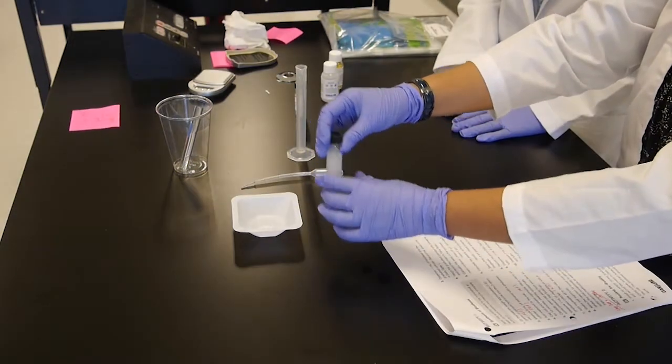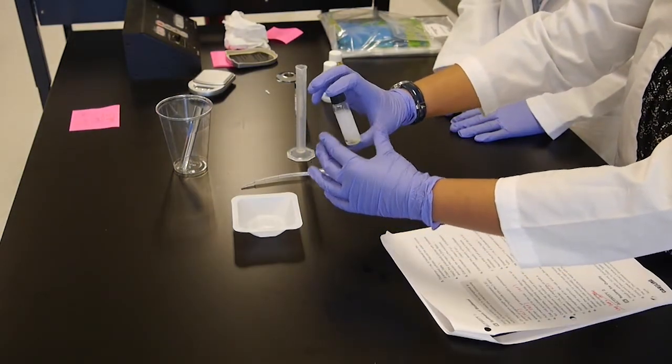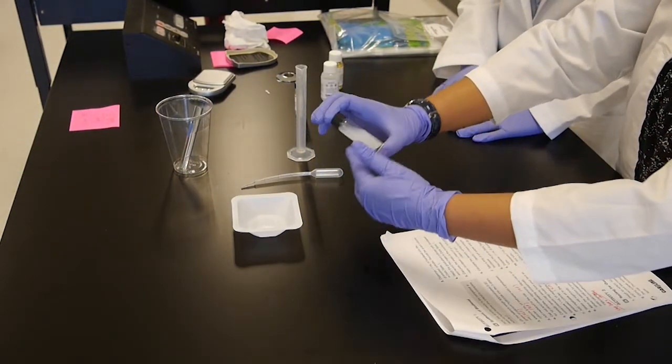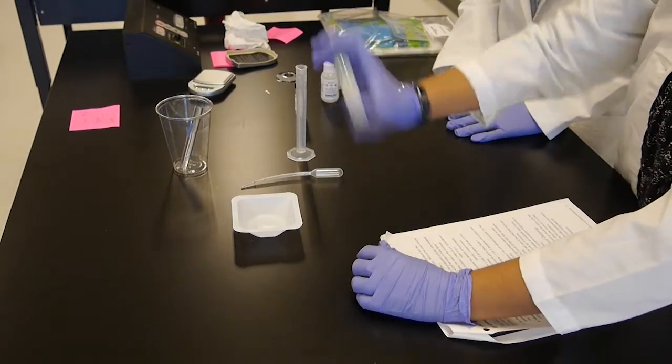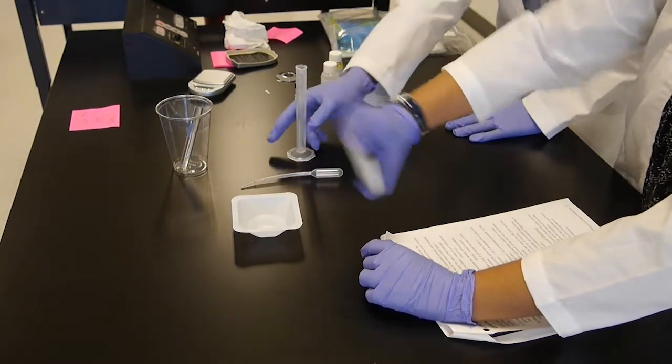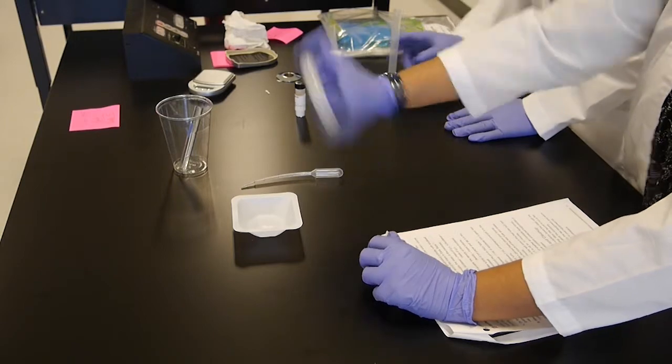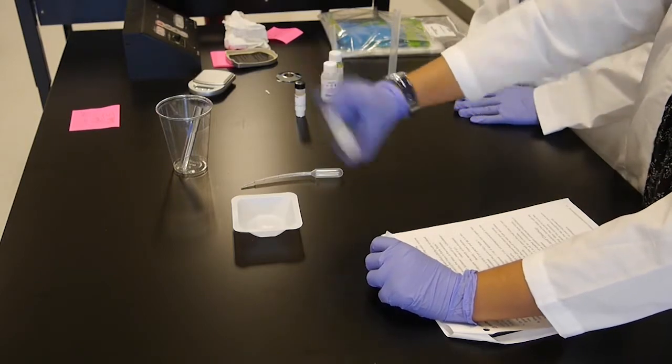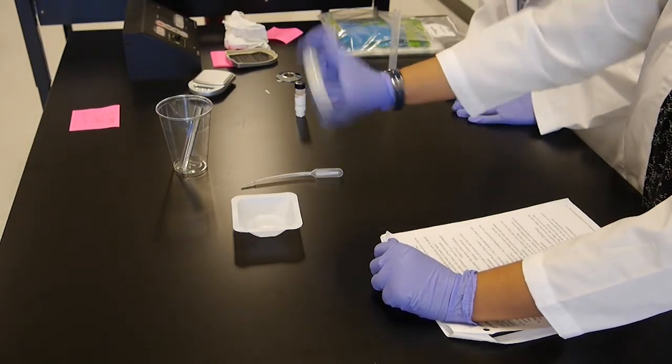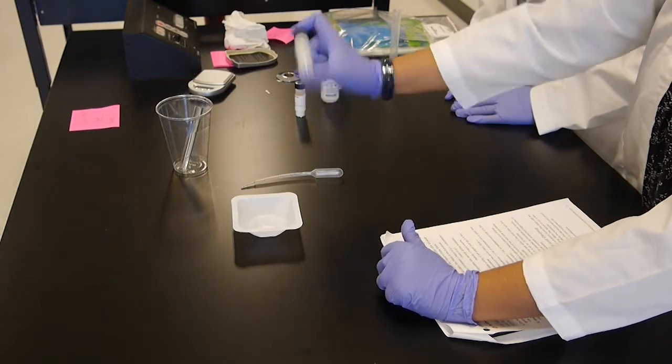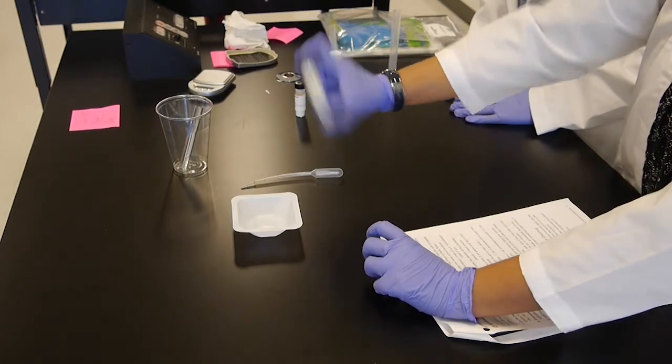So this will be the last step. You have to wait for 48 hours. Before that, make sure to vigorously shake it again. Mix it well. We will be back in 48 hours, and then we're going to do a quality testing on the biodiesel produced.